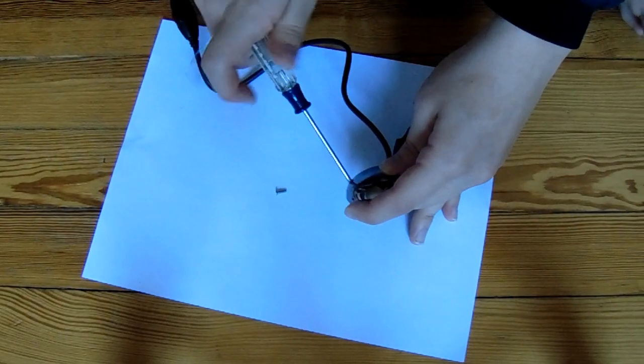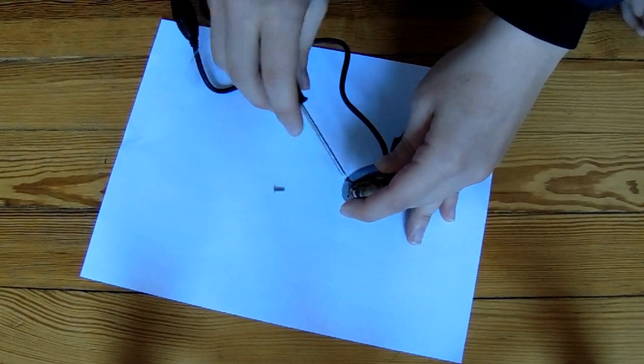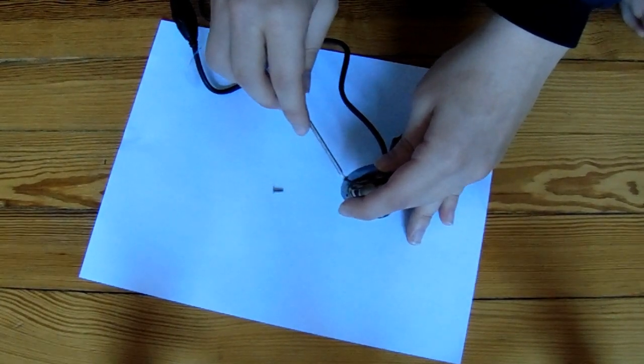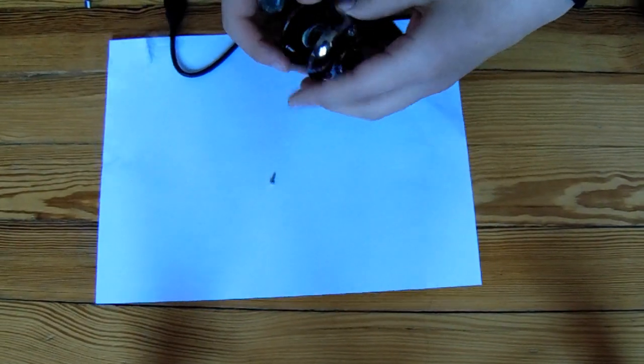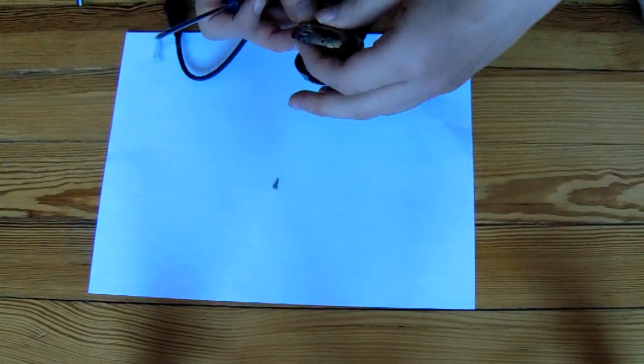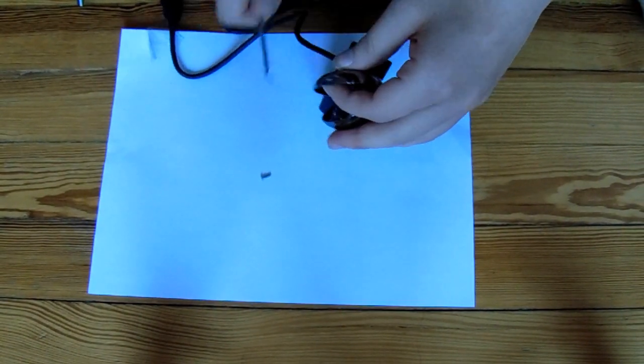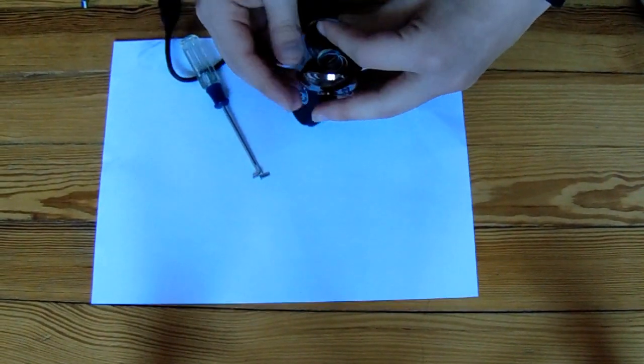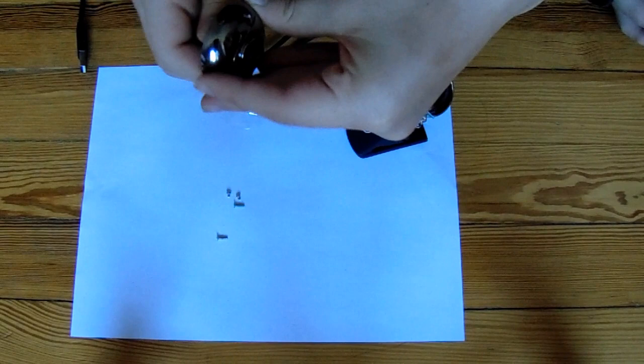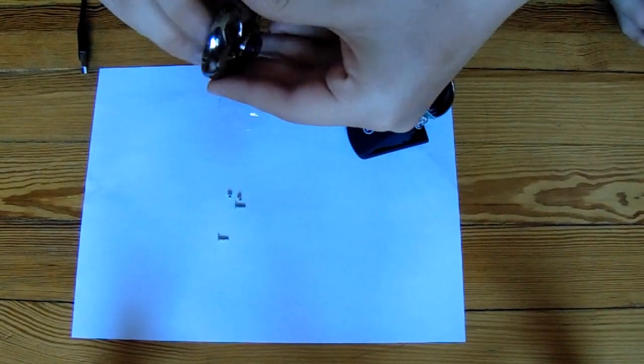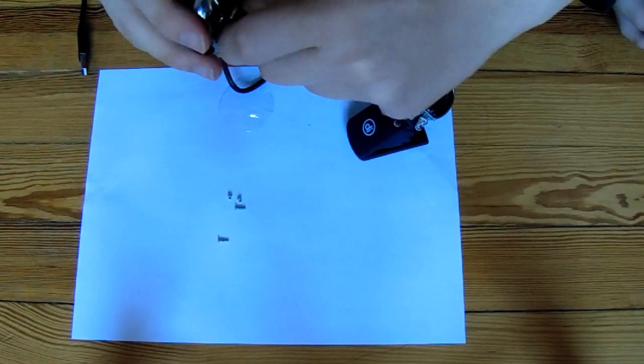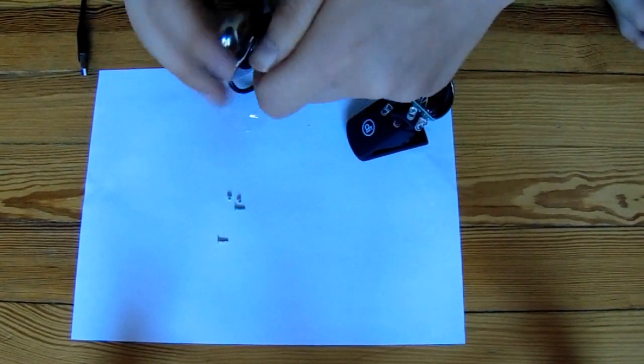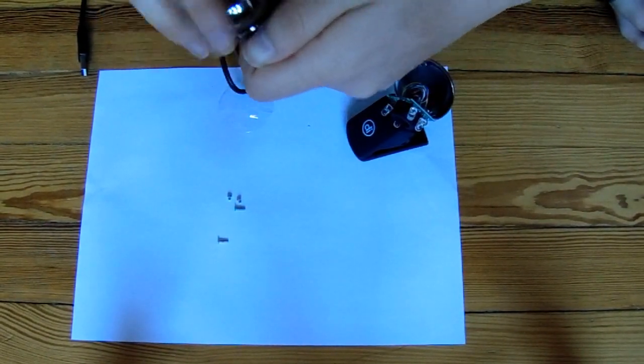This is already good, but we can do one better. This webcam has two lenses, a big one that we can see and a small one behind it, close to the light sensor. A standard compound microscope also has two lenses, but the smaller one is in front, not behind like our webcam. To fix this, we can just turn the optics around so the smaller lens is closer to us.